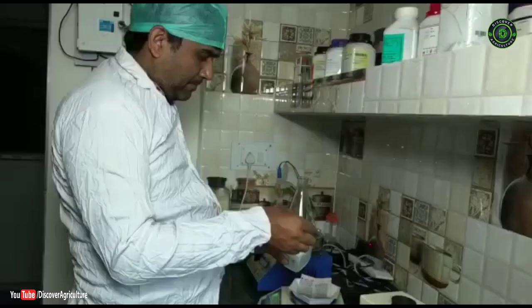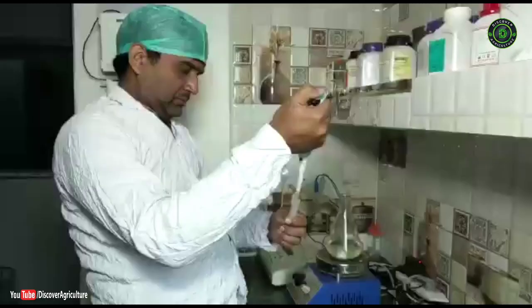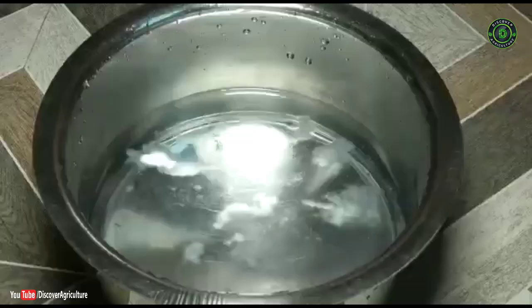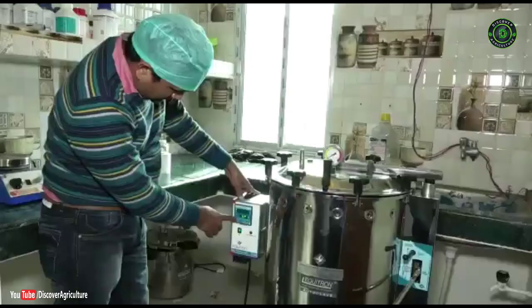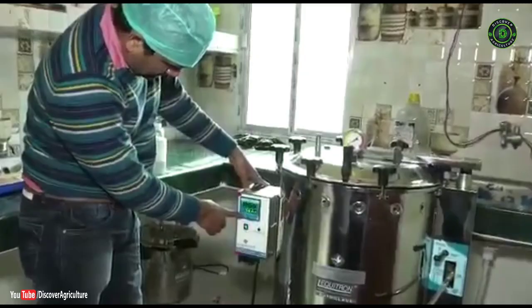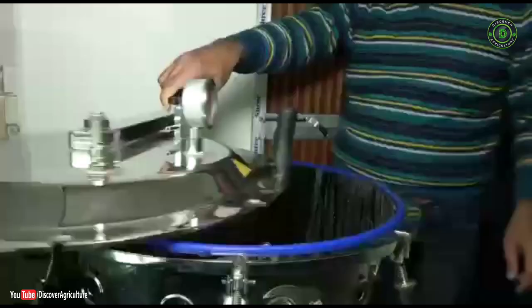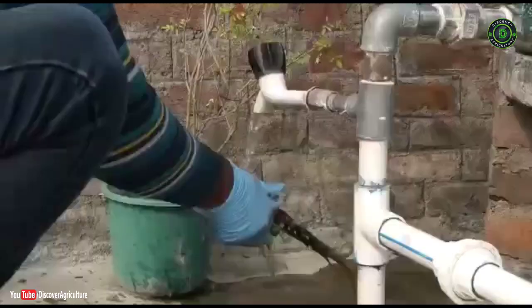To prepare the solid media, agar is used as a solidifying agent. It should be melted separately before adding to the final media composition. After reconstitution, the pH is adjusted to 5.8 and the media is autoclaved at 121°C at 15 lb per square inch pressure for 20 minutes. After autoclaving, the culture medium is stored in a clean, dust-free chamber for 1 to 2 days before use to check for any contamination.